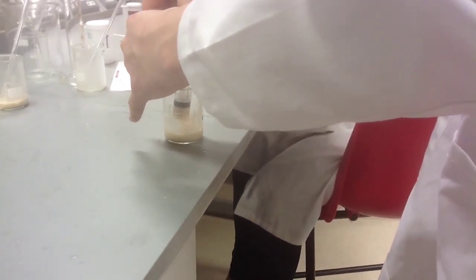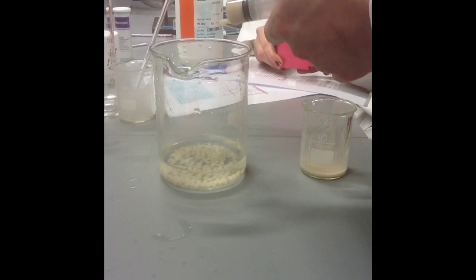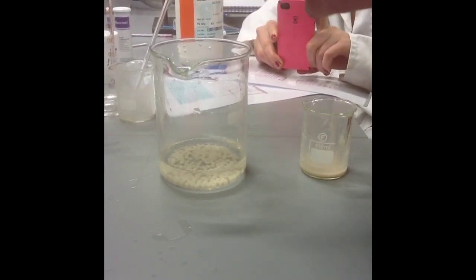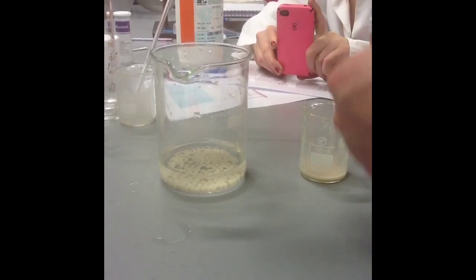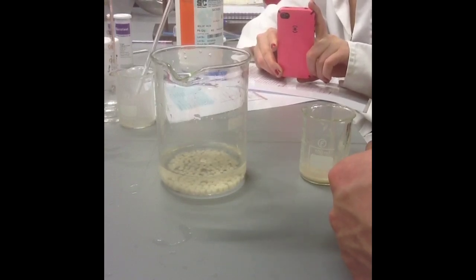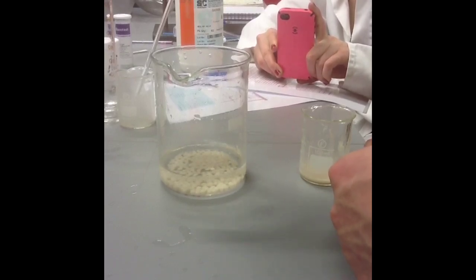Draw all of the mixture into a 20ml syringe. From a height of 10cm release the mixture from the syringe, one drop at a time, into the calcium chloride solution. Beads containing yeast cells will form. This is because the calcium chloride hardens the sodium alginate. When finished, leave the beads to harden for at least 10 minutes.